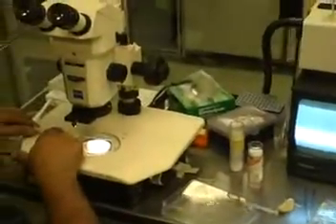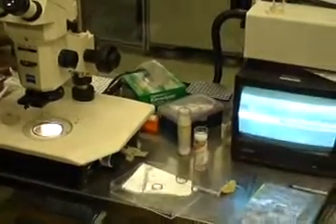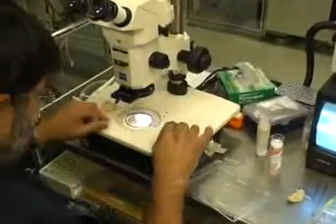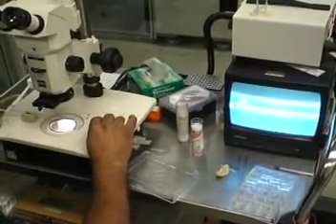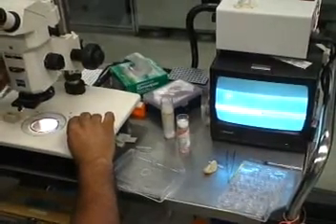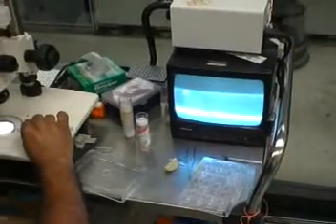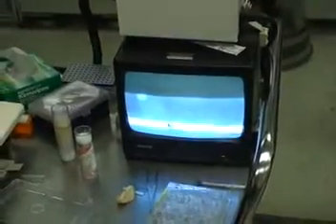Now we have to try to dry out the crystal, and there are several methods. One way is to put a paper wick; the other way is to use a syringe. This is a much smaller capillary — this is 0.1 — and I'm going to try to put it inside this capillary. When it's inside, you chase the edge by going inside. Now the tiny capillary is inside and we can dry the excess water.